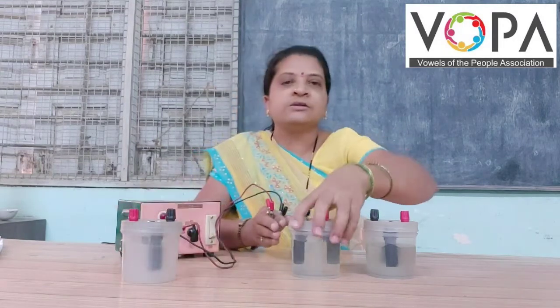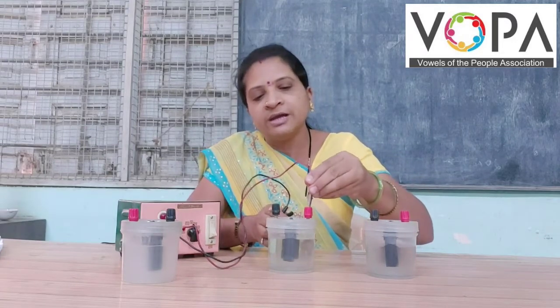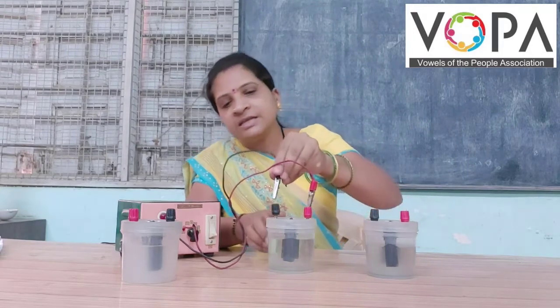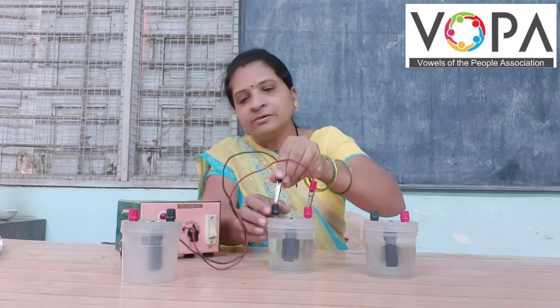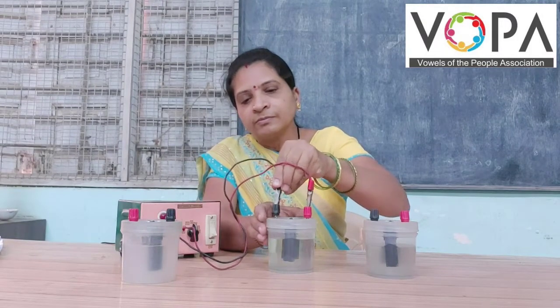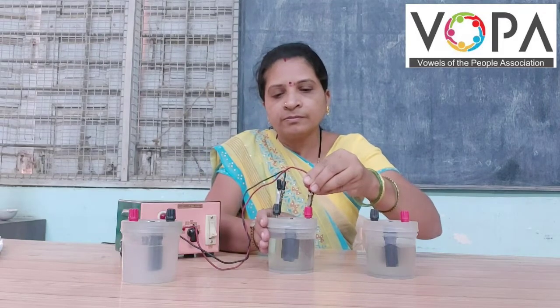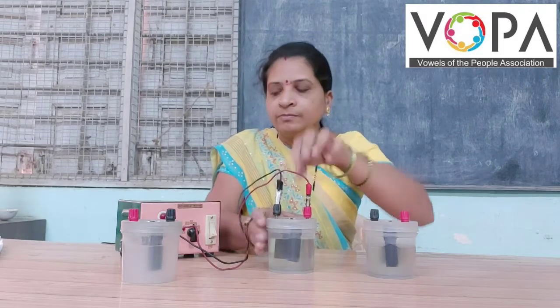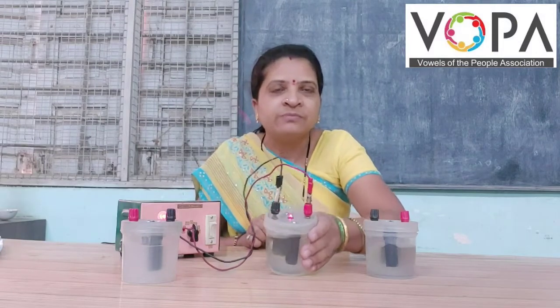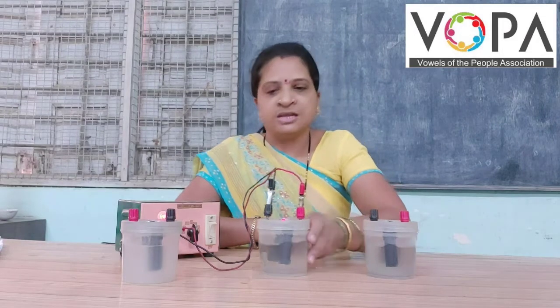Second one: we have taken the aqueous solution of potassium iodide. Now let us see if it is an electrolyte or not. The bulb is glowing. This indicates that this solution is also an electrolyte.